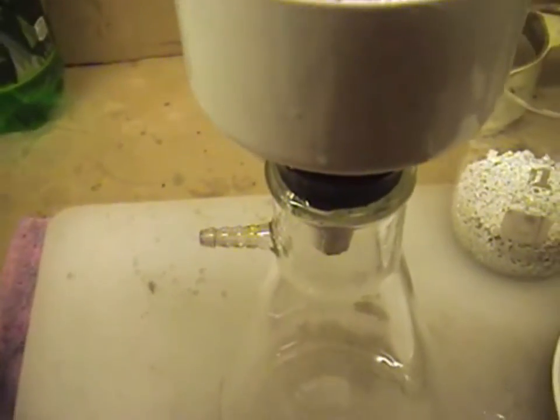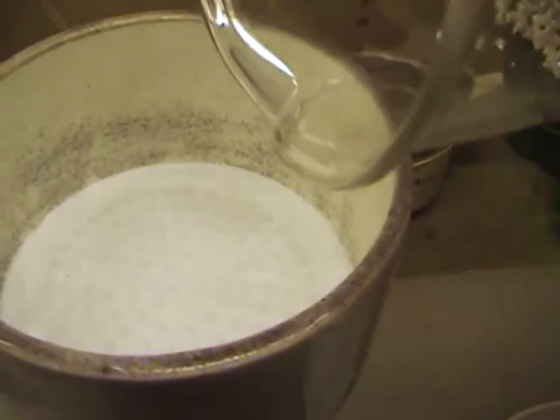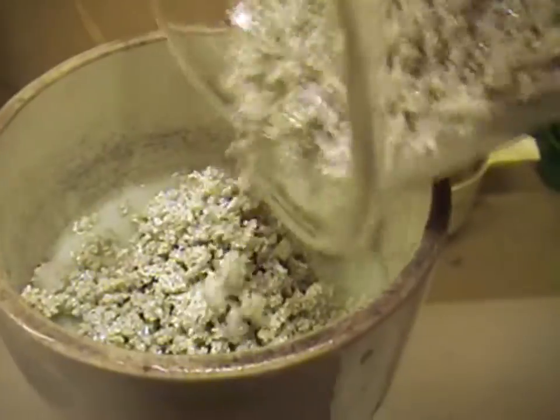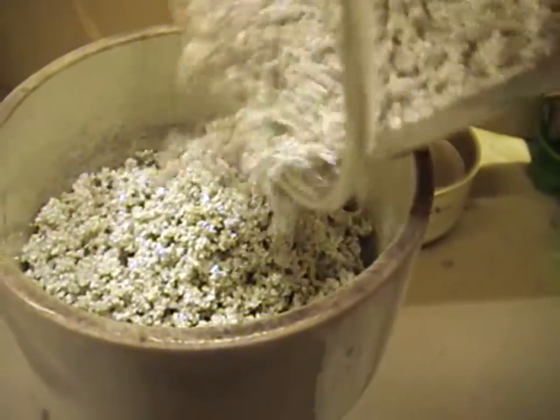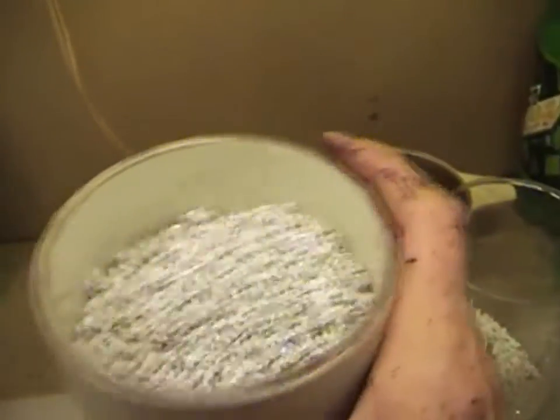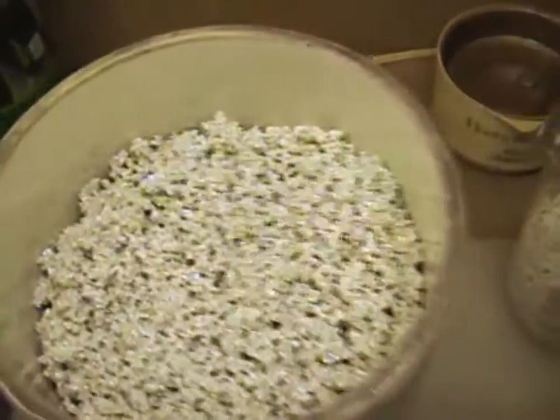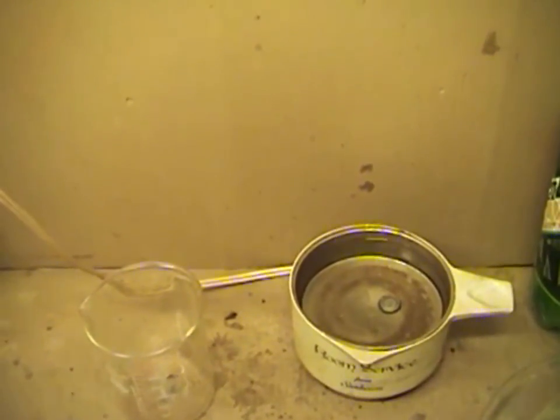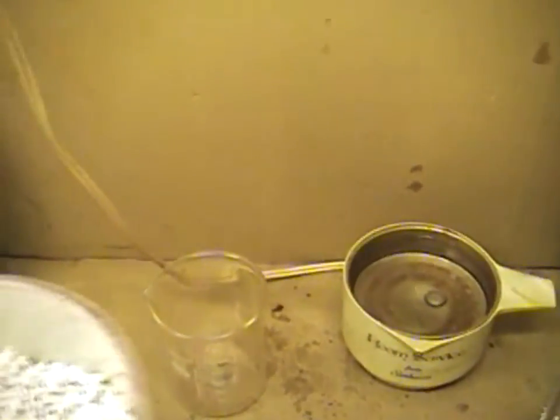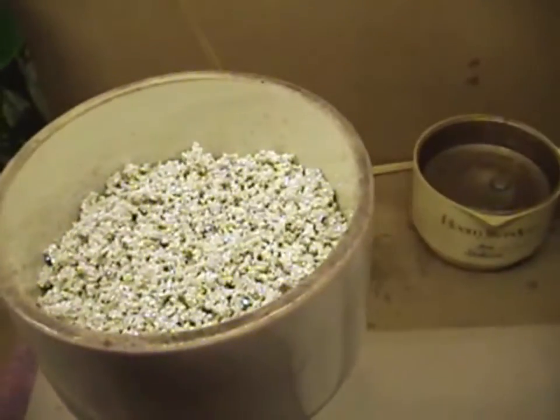The next thing we're going to do is pull our vacuum back off of our flask — we don't want vacuum at this point. These crystals will wash very well without vacuum. We're just going to pour some of our silver crystals in there, maybe about a half a funnel full, shake it around and tap the sides to get it to fall down. I have my little heating apparatus here and I'm going to go ahead and plug that up.